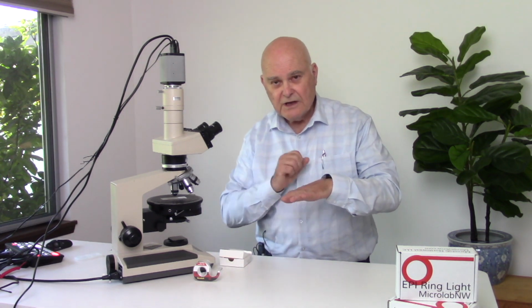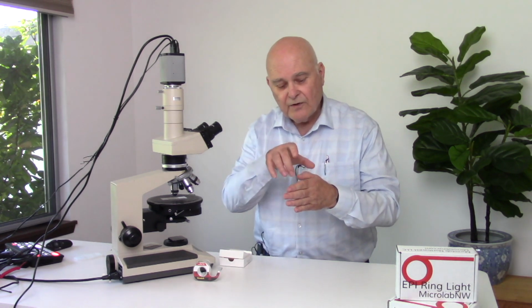So by that I mean that the particles will show birefringence based on the two refractive indices that are in the plane of the stage. If we were to rotate the particle, then we have two different refractive indices now that are in the stage. So we're not correcting for that.